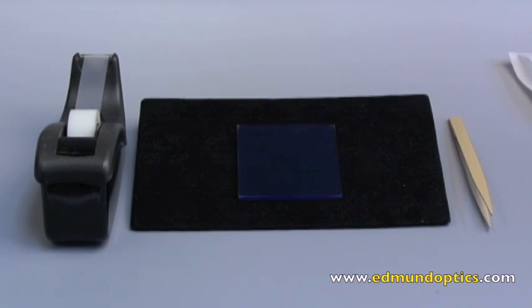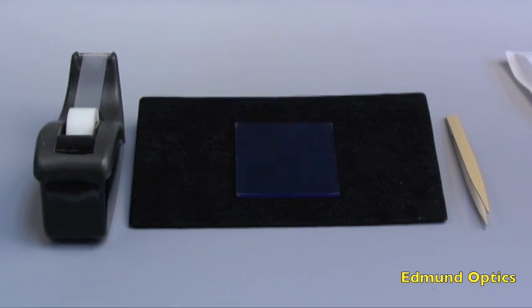First, I'll show you how to use scotch tape to remove the protective plastic coating from one surface of this window. Peel off a decent-sized piece of scotch tape a few inches in length in order to be able to securely attach it to the protective plastic coating and maintain a firm grip.